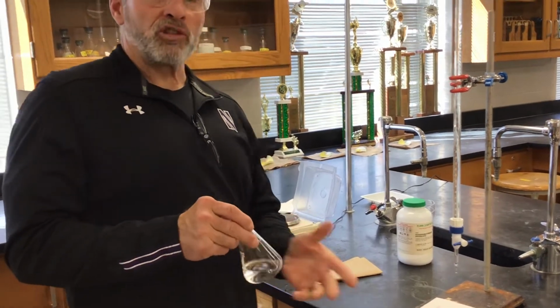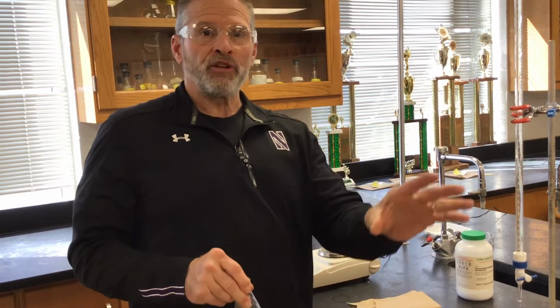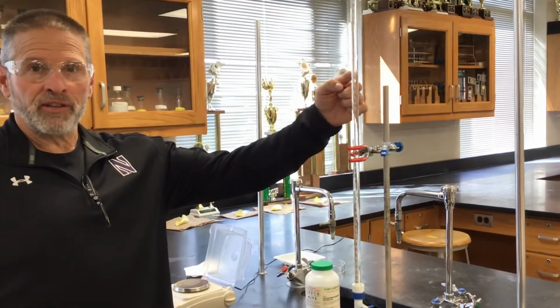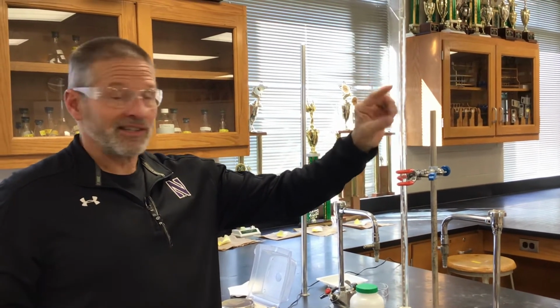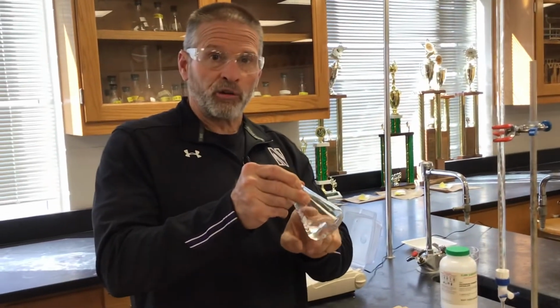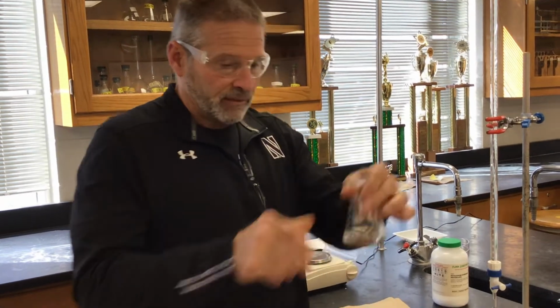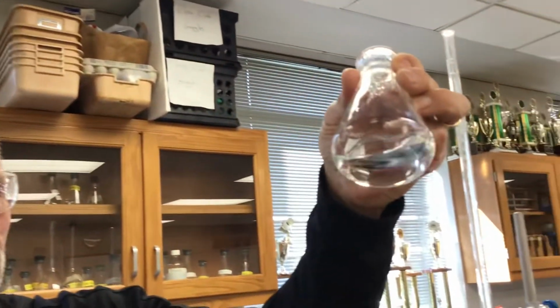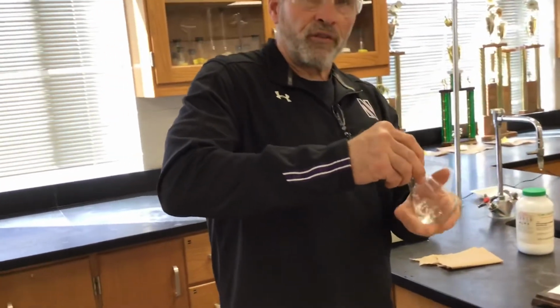Now, sometimes I have students get confused. After you've done part 1 of the lab, remember you know the molarity of this NaOH. You calculated it. You standardized it. This is the same NaOH. Now the game is you're trying to figure out the molar mass of this unknown acid that we're dissolving. It's confusing because you're doing 2 different titrations with 2 different purposes.